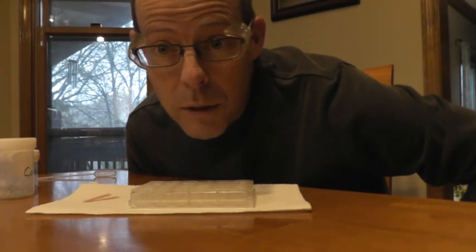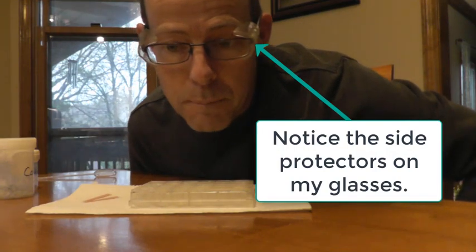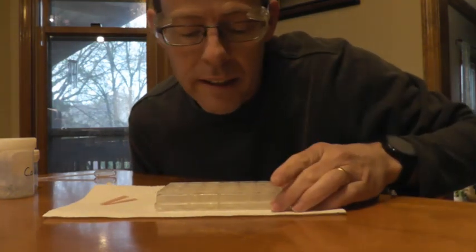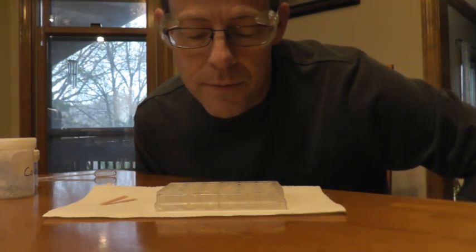Alright class, quick demo for you. This is a lab you would have done fourth quarter, but we're going to look at periodic trends, or that's kind of what we're looking at today anyways. So here's a quick lab on reactivity of metals.